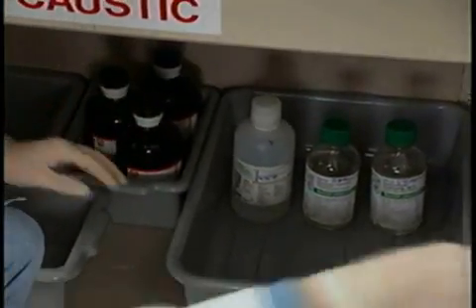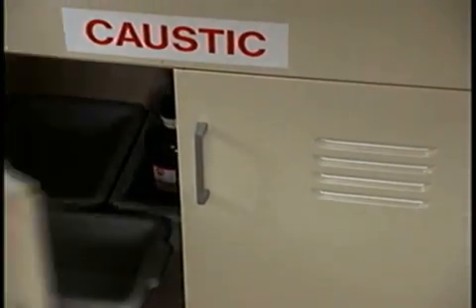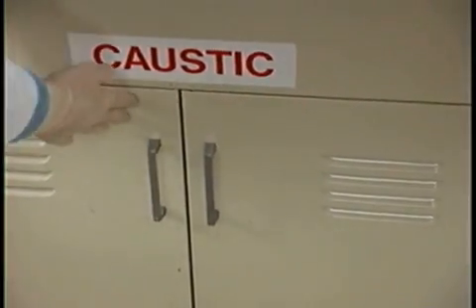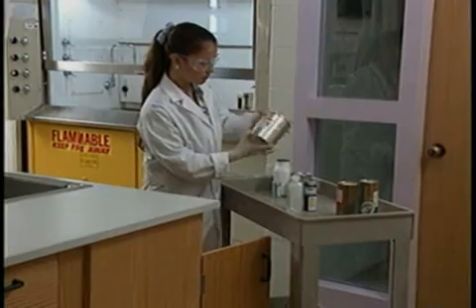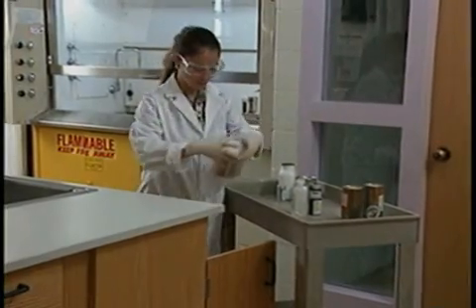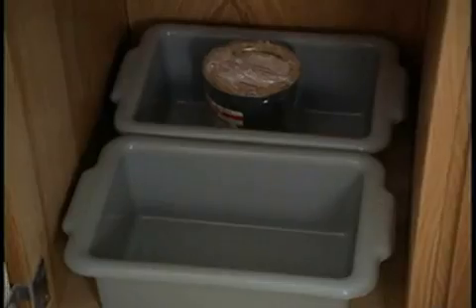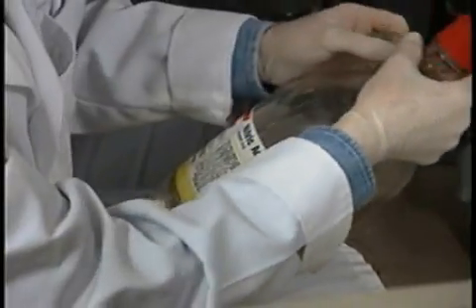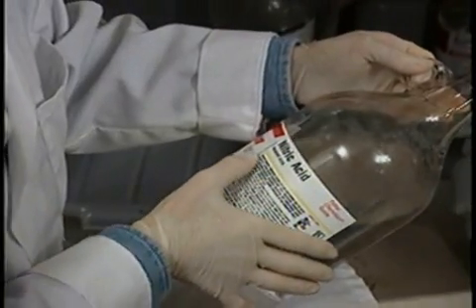All their cabinets are carefully labeled to cut down on the chance of putting an item in the wrong place. Oxidizers should be separated from other chemicals because they are highly reactive. For example, nitric acid can react violently under certain conditions.